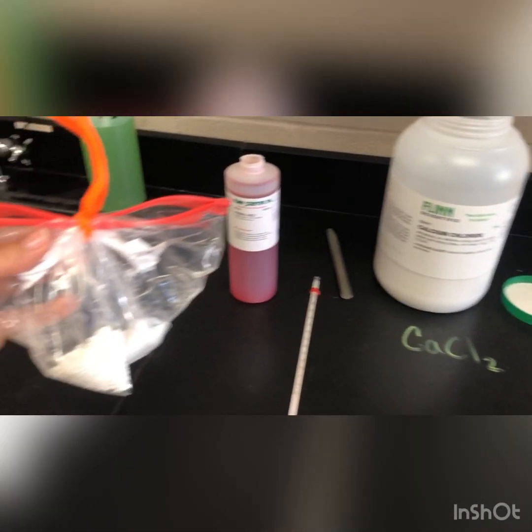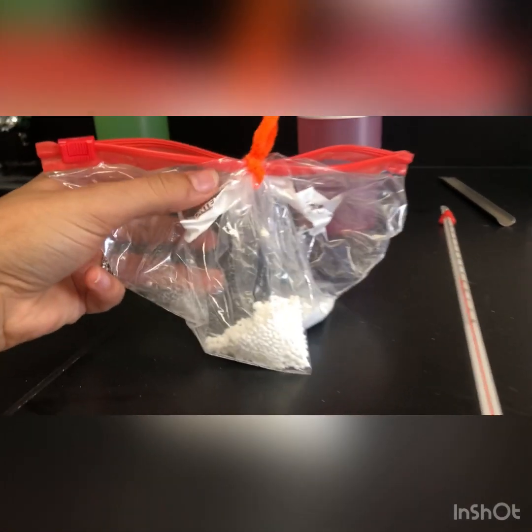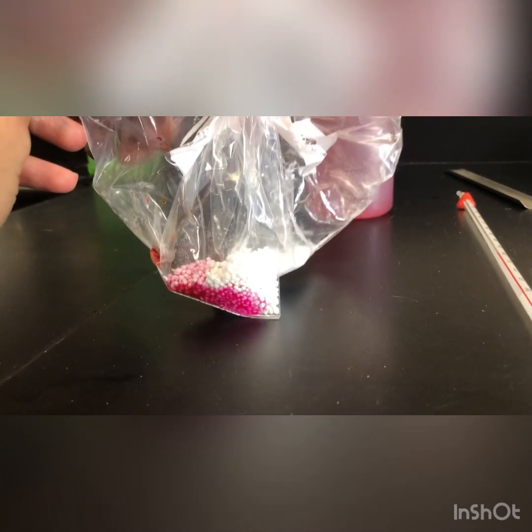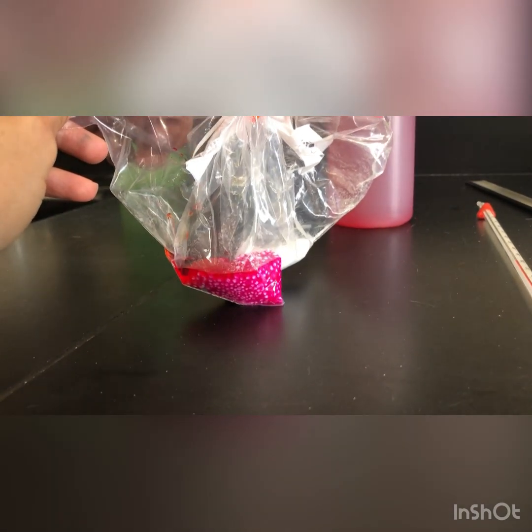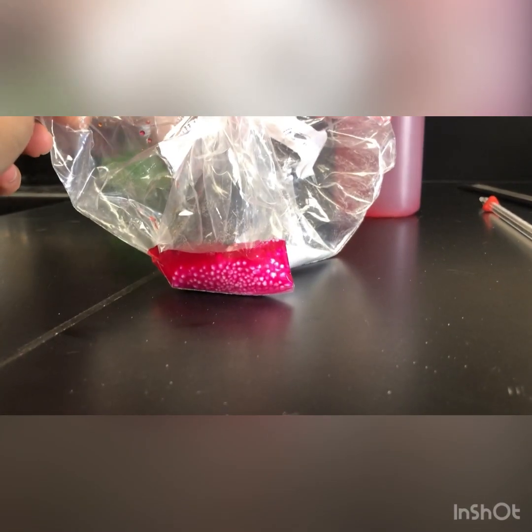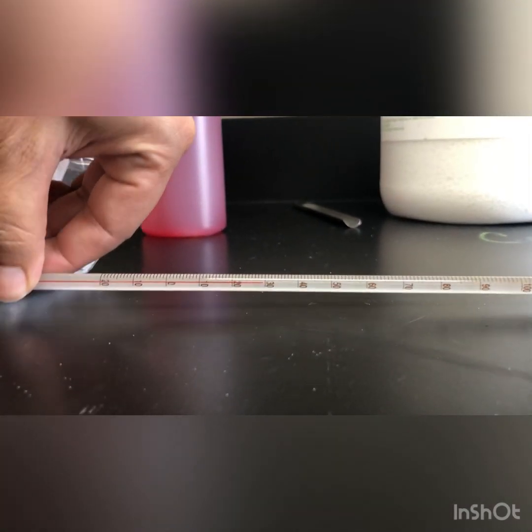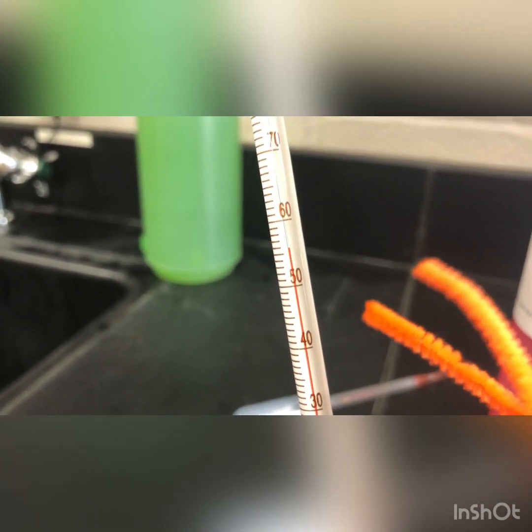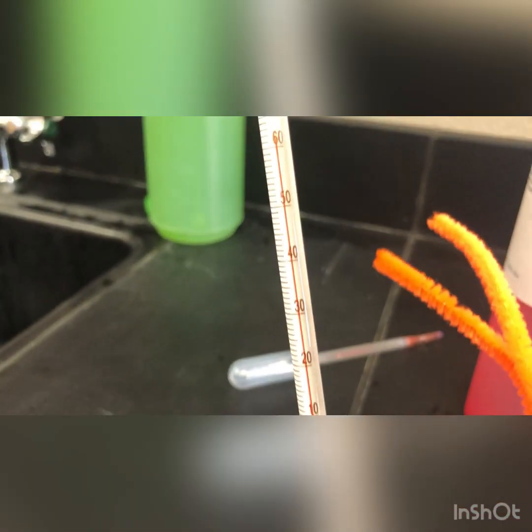Now we're going to go ahead and see what happens when we add phenol red into each compartment. We'll start off with the CaCl2 — I'm going to add enough phenol red just to cover the chemical. Go ahead and record on your data sheet if there's any evidence of a chemical change.